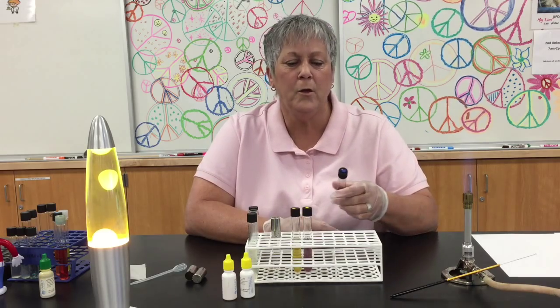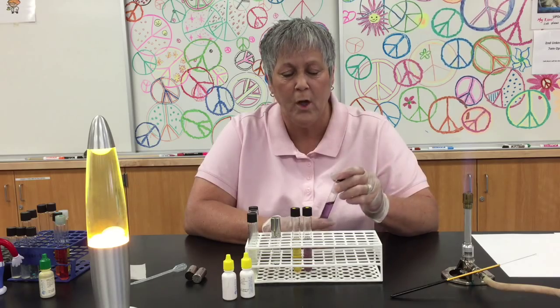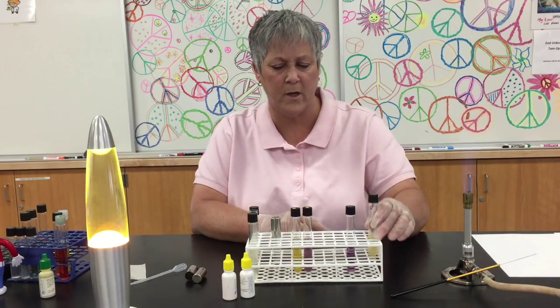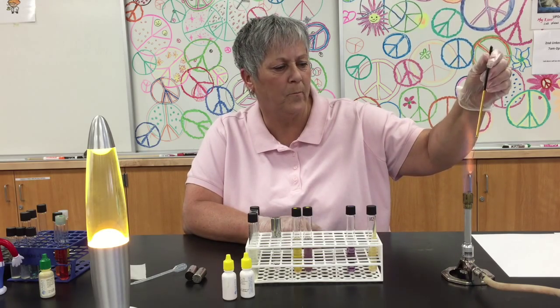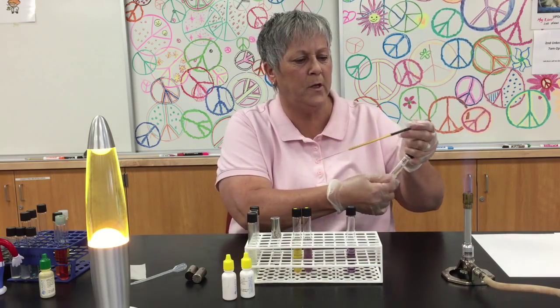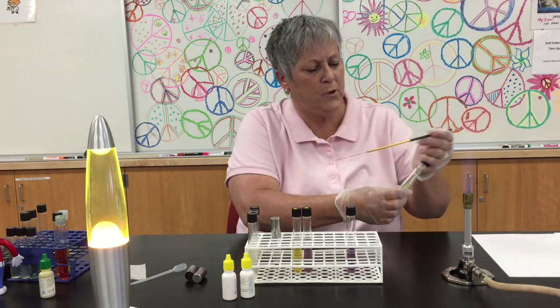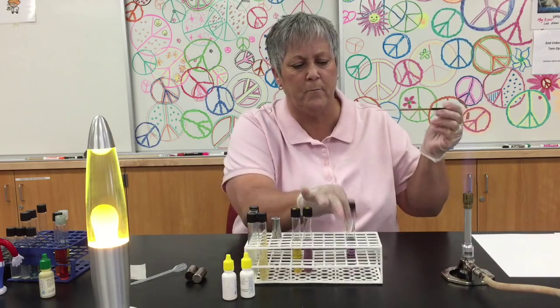Pretty much the broth looks the same. You'll see colored dots on the tubes, and there's a key available to help you determine which of the amino acids you're working with. To make my inoculation, I'm going to get my test organism, flame my loop, aseptically remove some of the test organism from the slant, and then swish the organism into the fresh tube of decarboxylation broth.